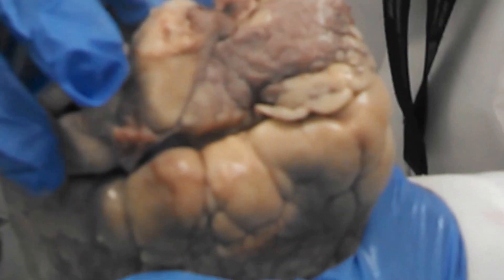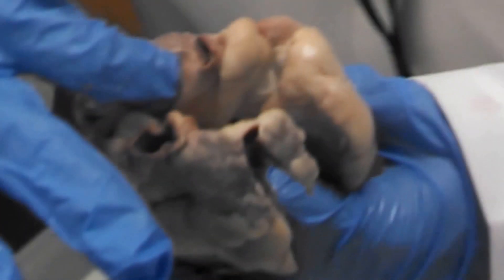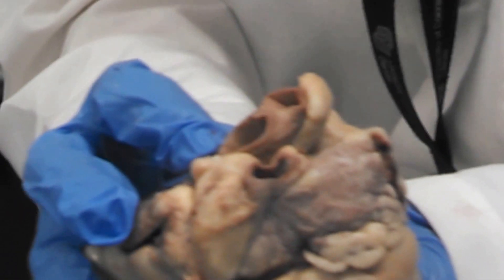If we move to the top of the heart, the aorta and the brachiocephalic come off of the very top here. So, again, if we were to orient ourselves: here's our superior vena cava, here's our aorta and brachiocephalic. If I were to stick my finger down in here, the aorta goes all the way down into the left ventricle.